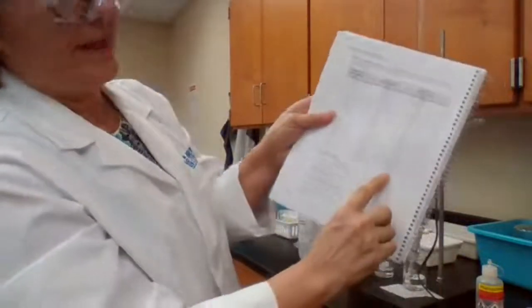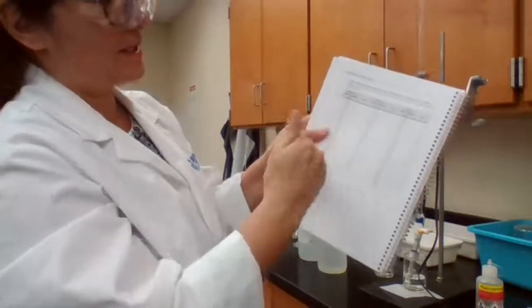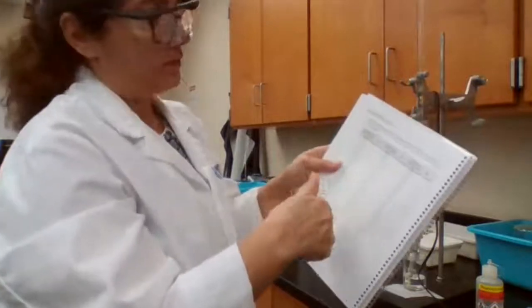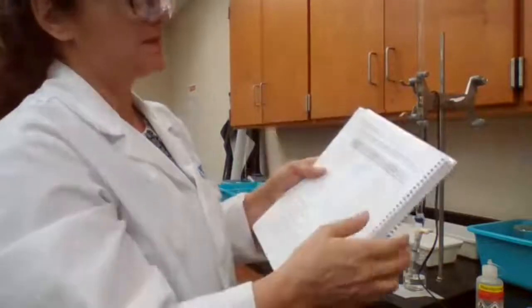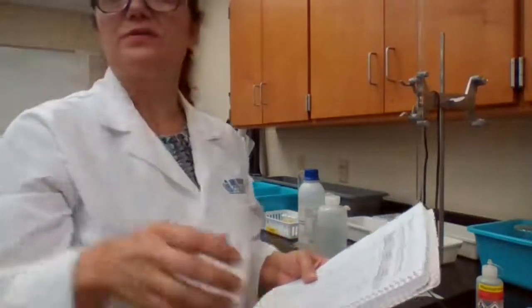I may not add the 29 milliliters. I'm going to stop after I first add, and I see the increase in pH, then I see a big jump. When I say big jump, it would be more than 1 unit of pH change. So if it goes from 6 to 8, or 7 to 9, or 8 to 10, whatever, then I will stop. After that, I continue with 4 more readings. I'm trying to see how it's going to make it easier for me for recording, but let's see.